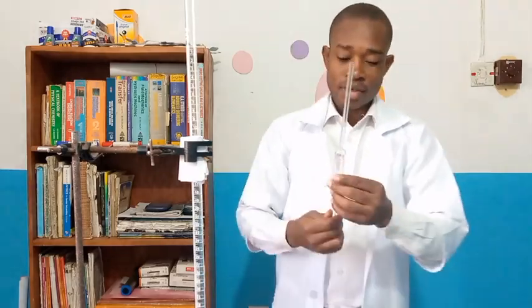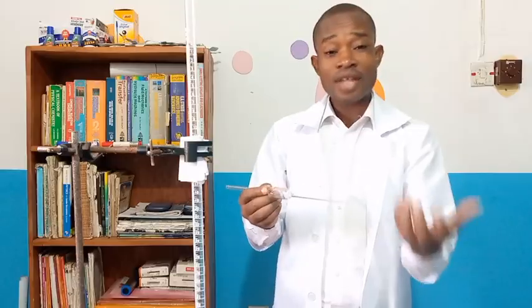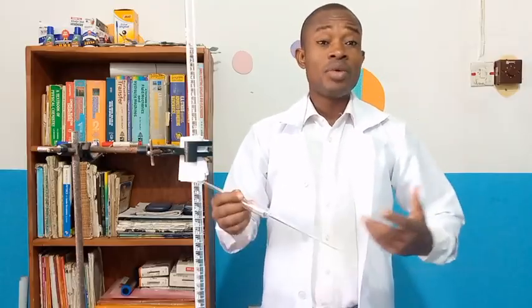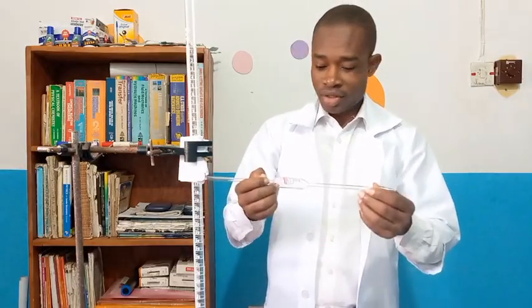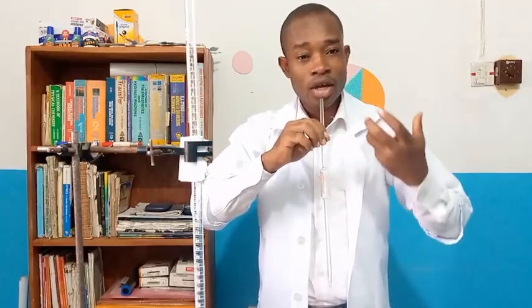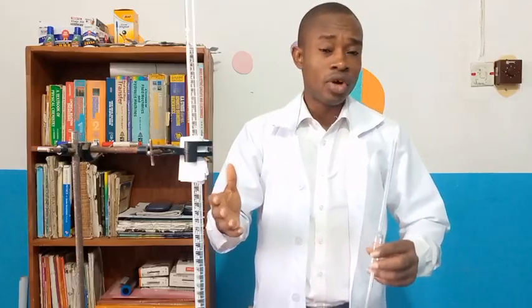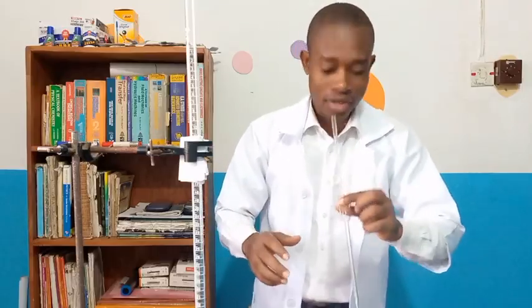And of course, very important is our pipette. This is a 25 ml pipette, 25 cubic centimeter pipette, because we're going to use this to get the quantity of base that we require for the titration. This will mean that we have to suck. We'll put this end of the pipette into the base, and then we're going to suck 25 milliliter, also 25 centimeter cube volume of the base, something like this.